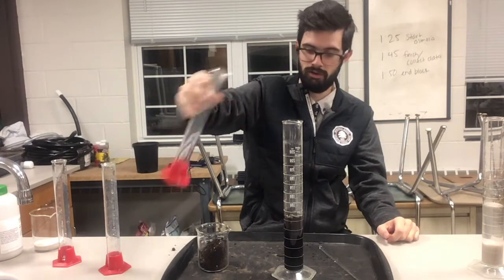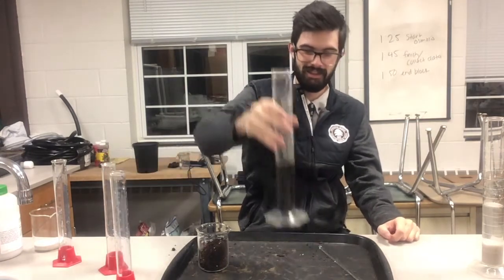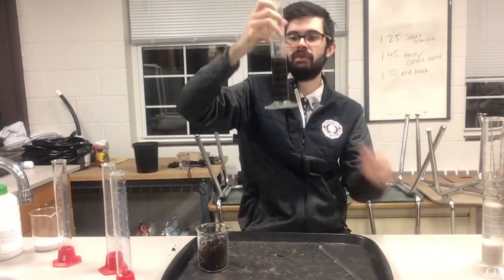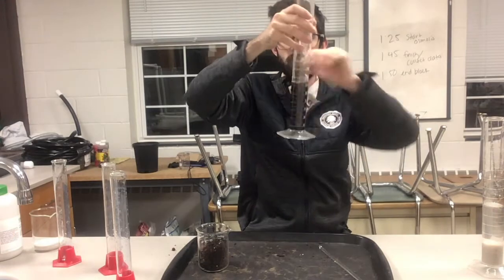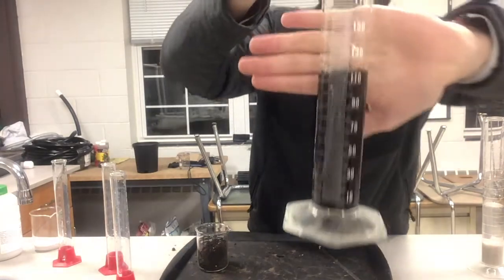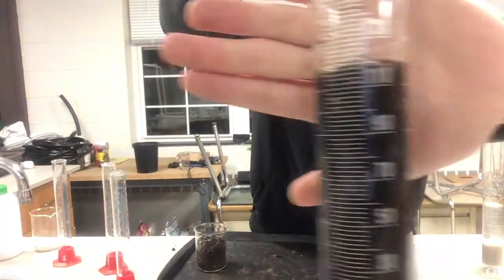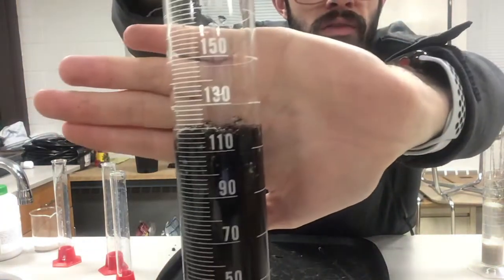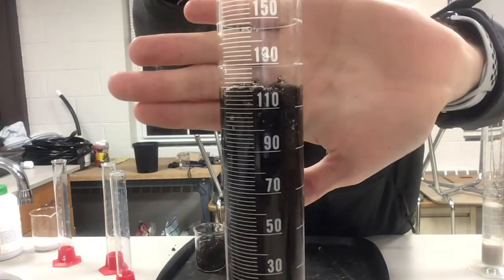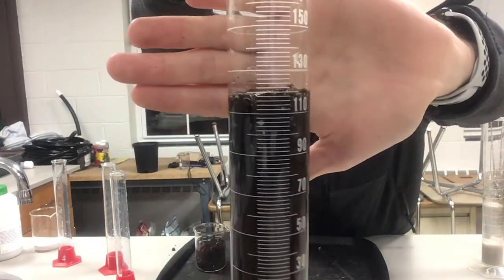Take a look at that reading. Where does the water level reach? Go ahead and record that measurement.